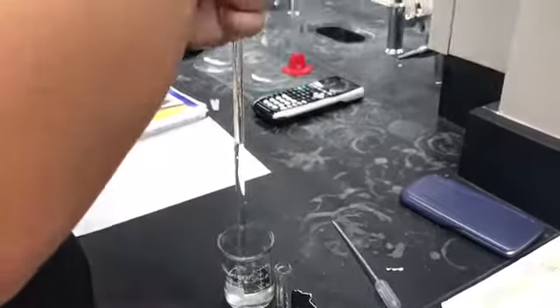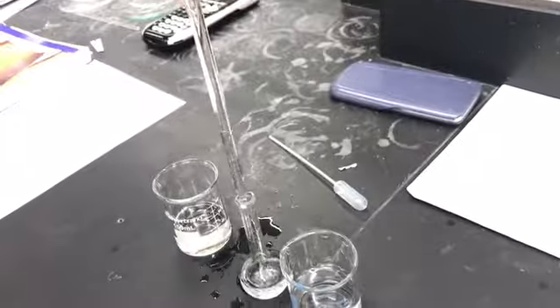The meniscus is the bowl-shaped dip in the liquid we are measuring. It is formed because the surface tension of the liquid causes the edges of the liquid to cling to the sides of the vessel. The center of the liquid doesn't have as much surface tension though, so it sags down, thus forming the meniscus.